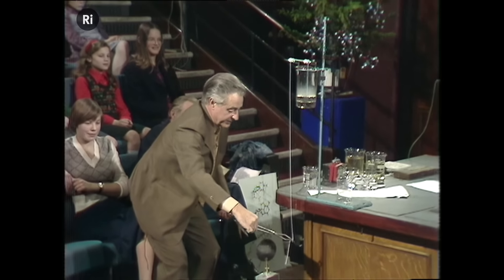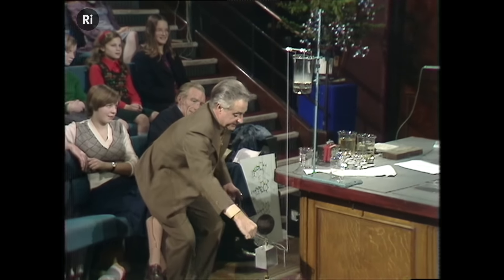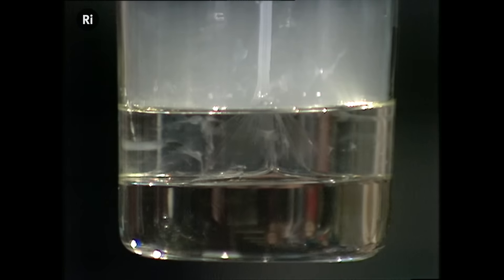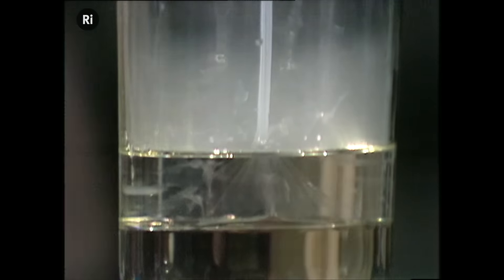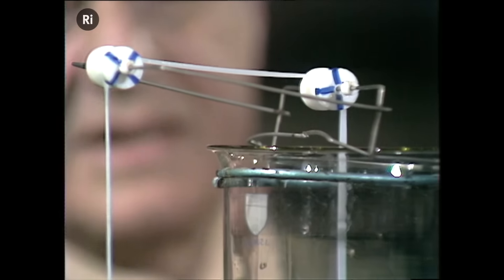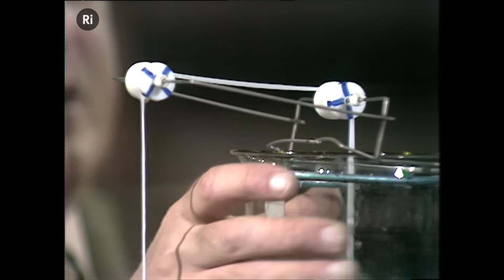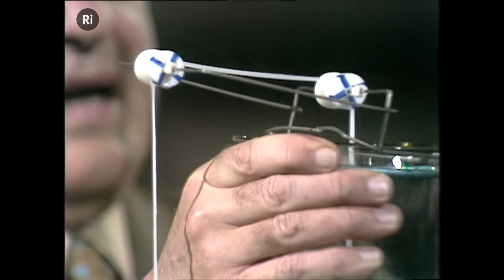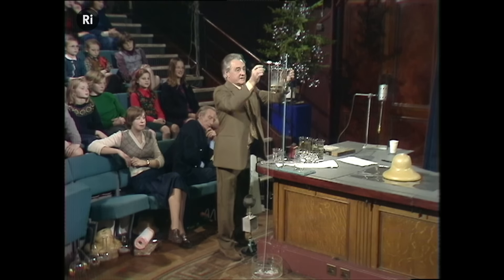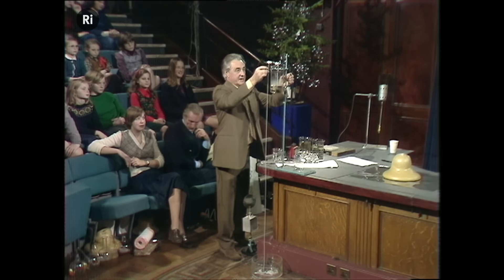And then I don't have to work very hard if gravity will do it for me. Let's see whether gravity will do it for me. There it goes. And it'll go on spinning until it's used up all the liquid. And that's a nylon thread. Let's let gravity have a bit more chance by raising it.